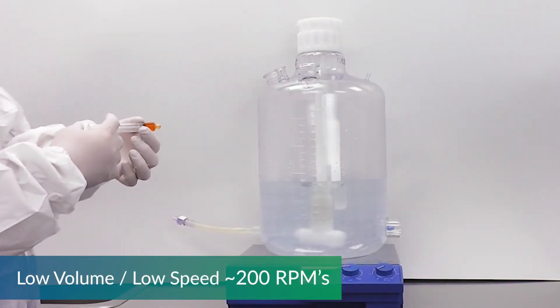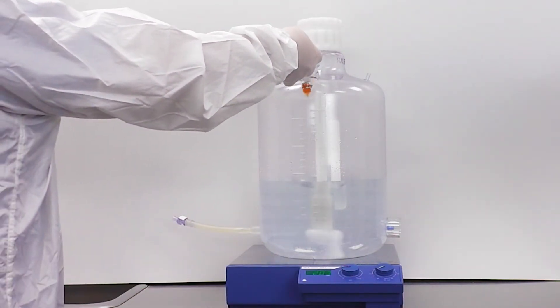This test is low volume, low shear, running at a speed of 200 RPM.